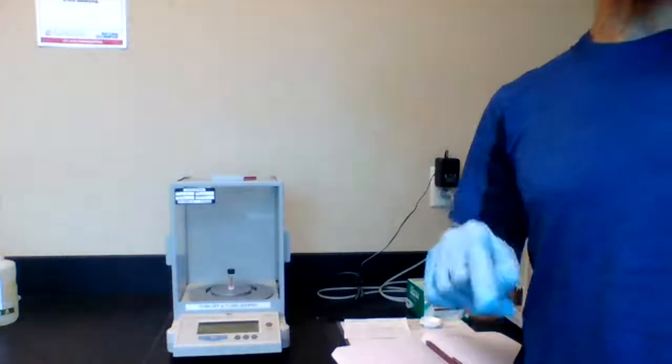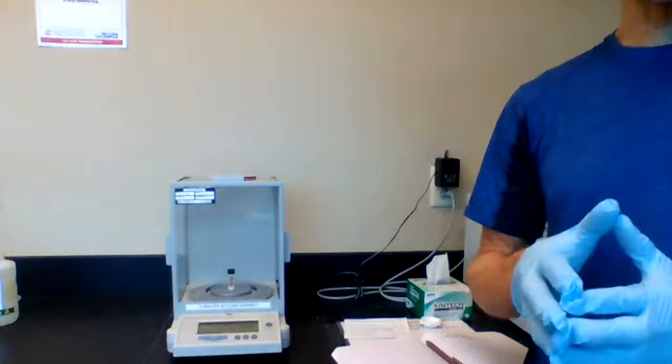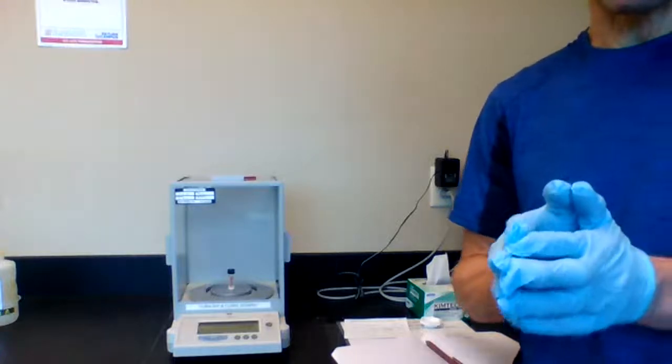But we're going to use that information to conduct our titration, which is going to be our next short video.